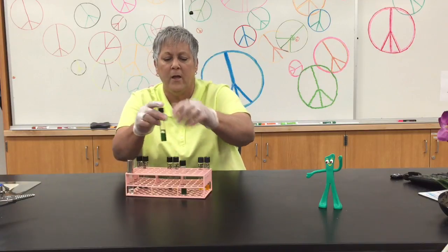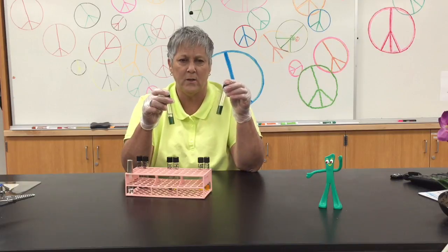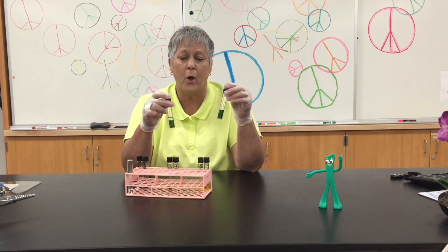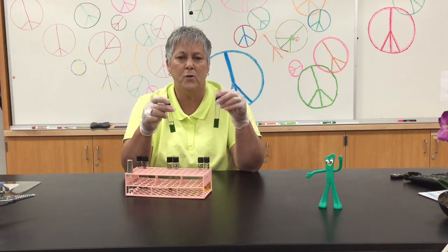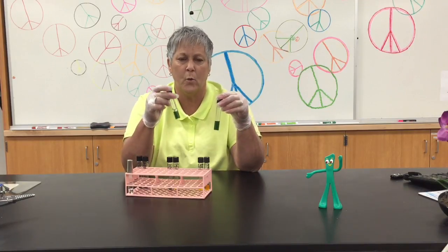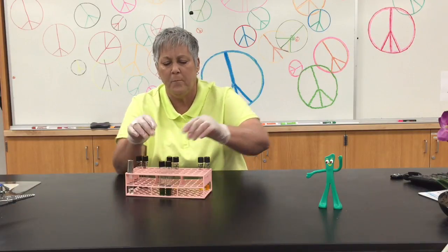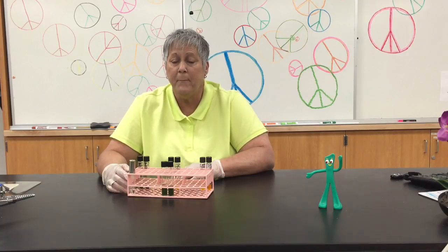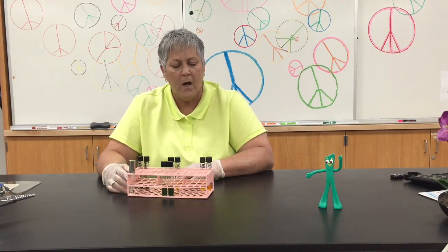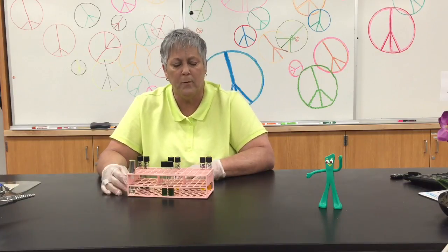So once they're inoculated, I will have 1 tube that doesn't contain oil. We refer to that one as the open tube, meaning open to air. And then the tube that I've put oil in, we refer to that one as the closed tube, and I mean closed to air, so we're going to have anaerobic conditions in this tube. After incubation, what we're going to do is look at what happened in both of the test tubes. And we're looking for a color change from green either to yellow or possibly blue.